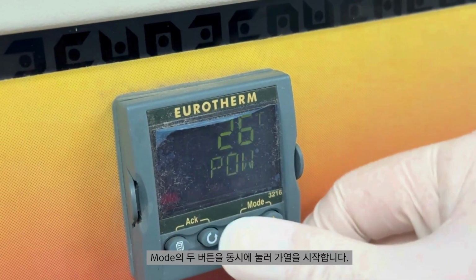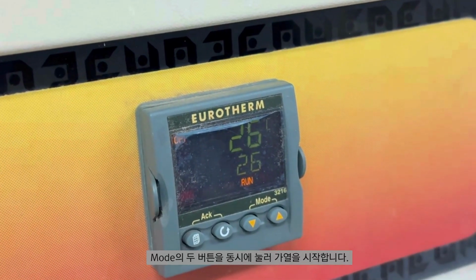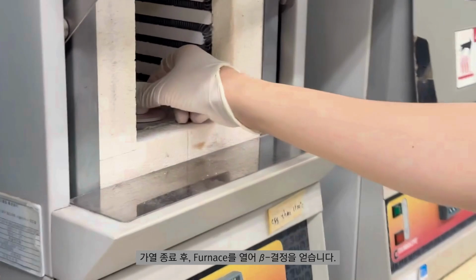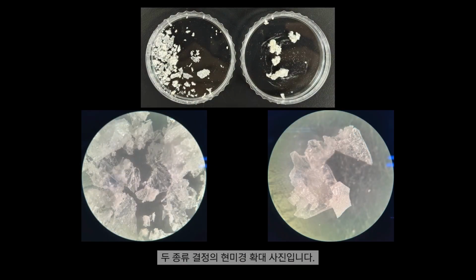To begin heating, press both buttons under the mode setting simultaneously. After the heating process is complete, open the furnace to obtain beta crystals. Here are the microscope images of the two types of crystals.